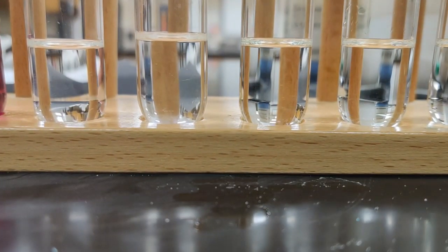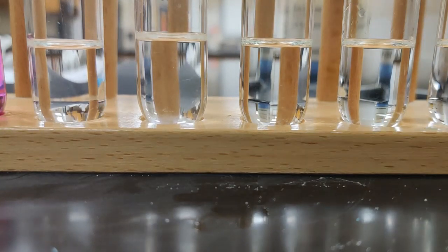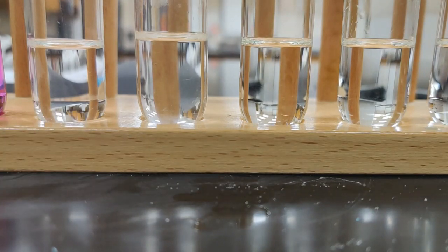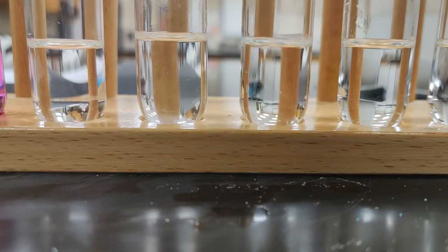So now we're going to try our copper 2 sulfate. We got to get some little bits of this to try it out. To do a little digging around in my container. The chunks are kind of big, but there we can get some little pieces. So we're going to take our little pieces and we're going to go straight into this fourth one.